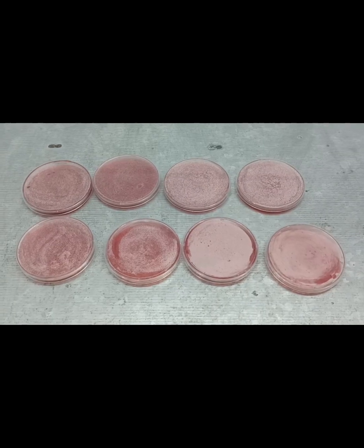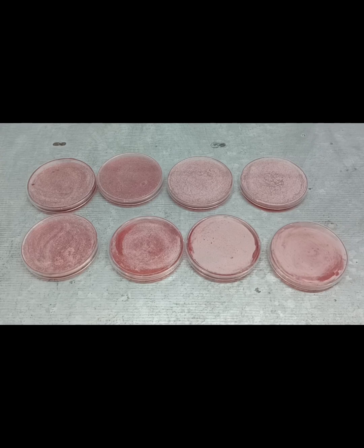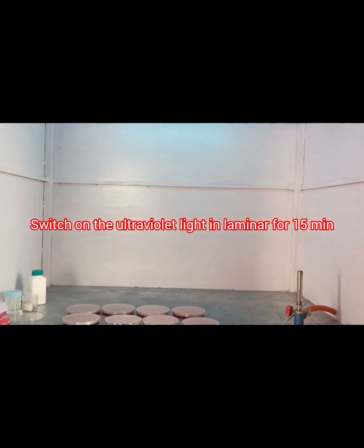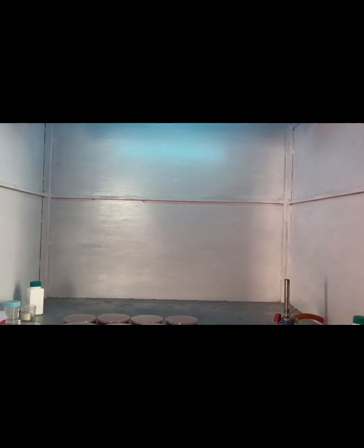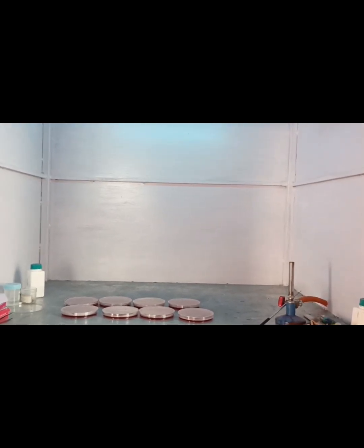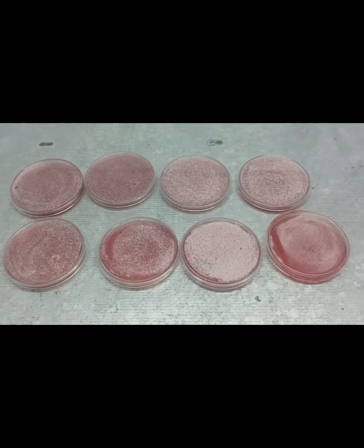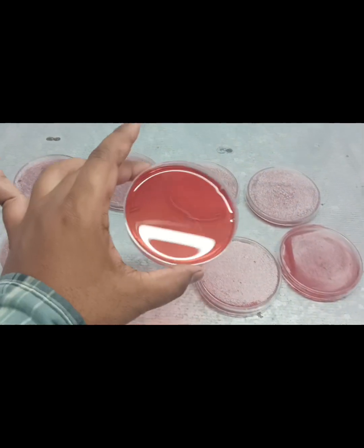Finally, we have prepared 8 MacConkey agar plates. After that, we switch on the UV light of the laminar airflow and close the lid of the laminar airflow, allowing the plates to cool. We should remember that the total pouring process should be completed inside the laminar airflow. After proper cooling, MacConkey agar is now ready.